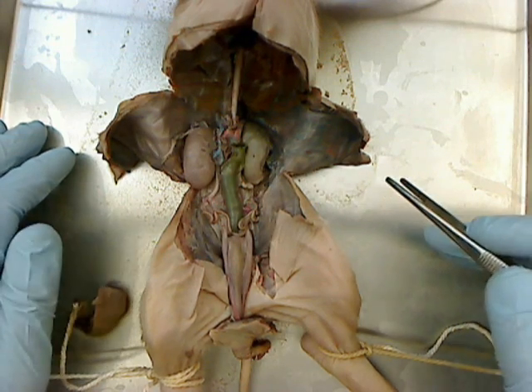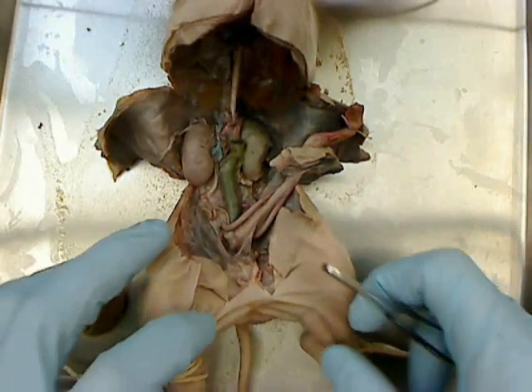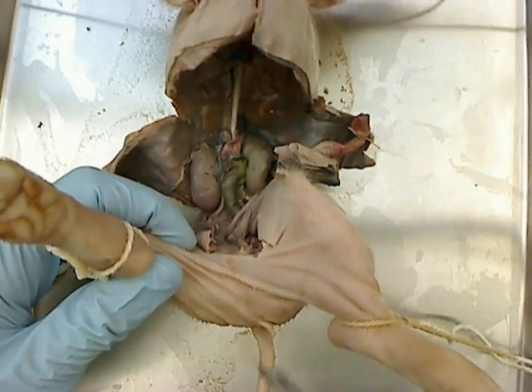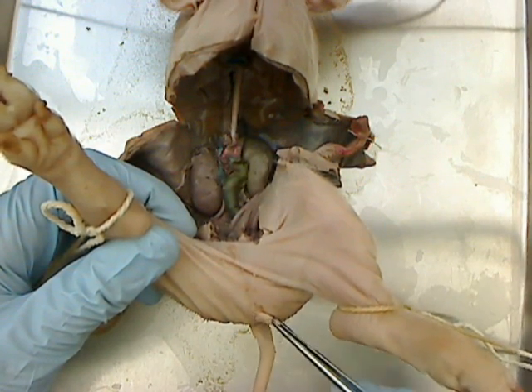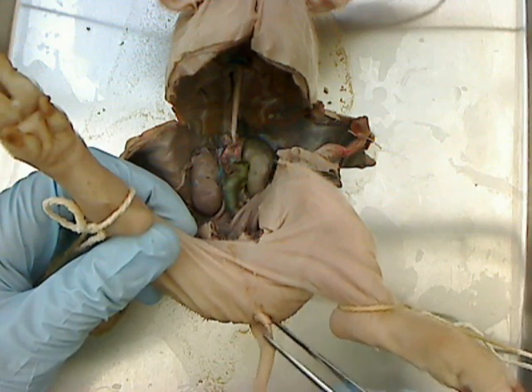This is a female fetal pig. You know it's a female fetal pig from the outside, without even doing any dissection yet, by looking near the anus under the tail for the genital papilla, which looks like this. That's the genital papilla.